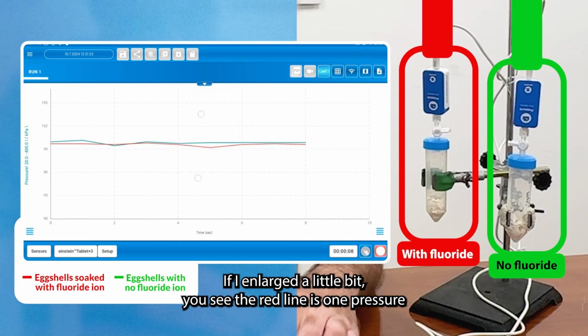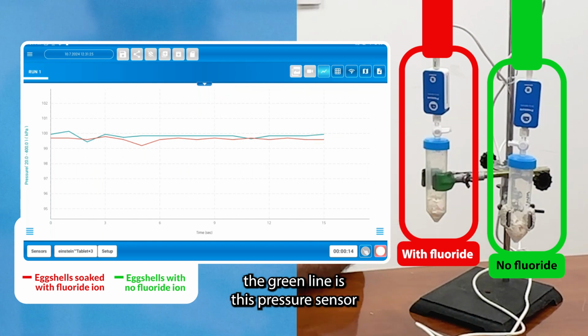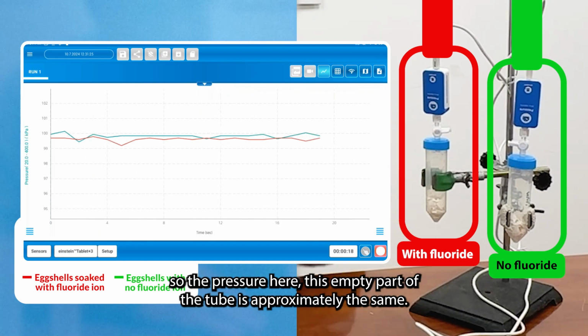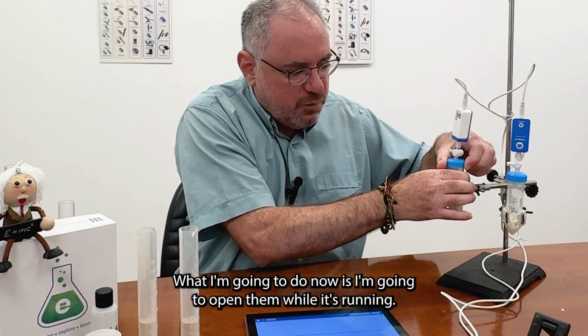If I enlarge it a little bit, you see the red line is one pressure sensor, and the green line is this pressure sensor, and they're quite the same. So the pressure here, this empty part of the tube, is approximately the same. So what I'm gonna do now is I'm gonna open them. While it's running, it's okay.